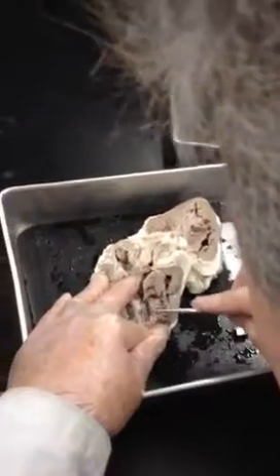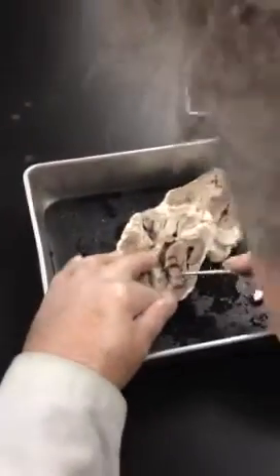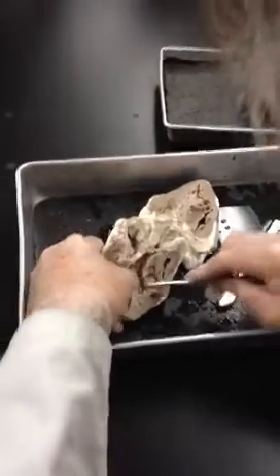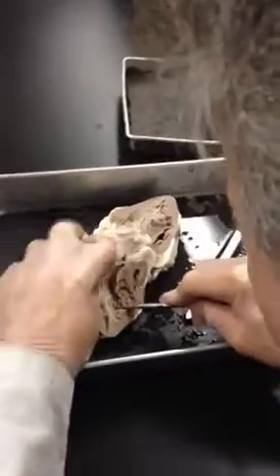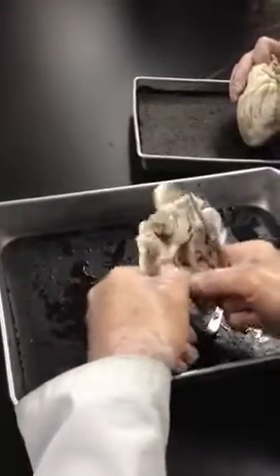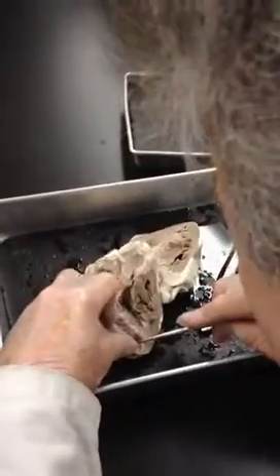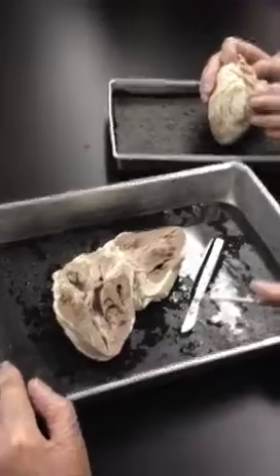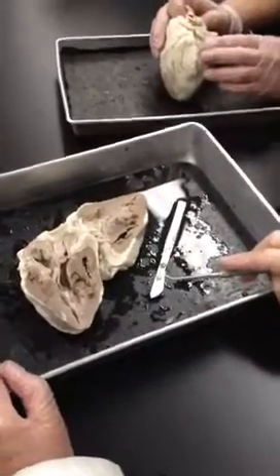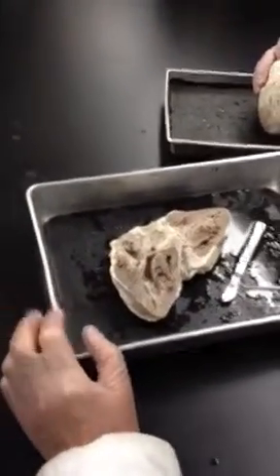That's the trabeculae — like the trabeculae in your spongy bone, remember? This is trabeculae too. These are extensions with holes in between. Now over here there is a moderator band, but that's hard to see. When the ventricles are contracting, the moderator band prevents them from contracting too strongly — it's a band of muscle to control ventricular contraction.